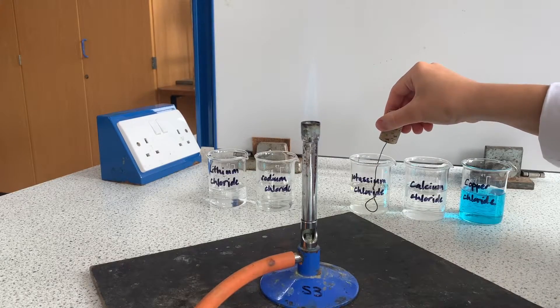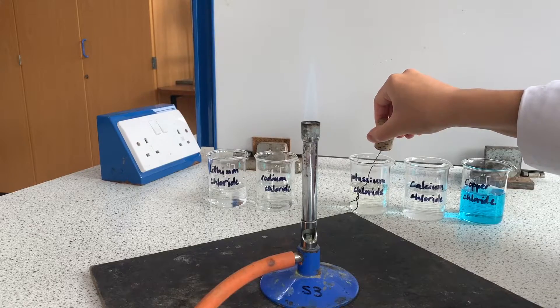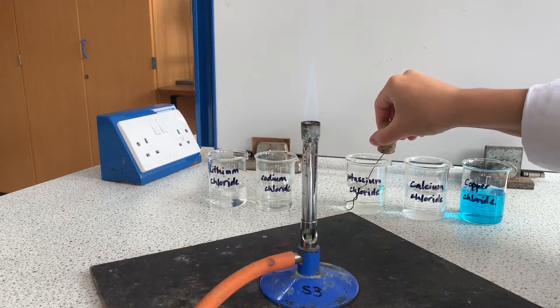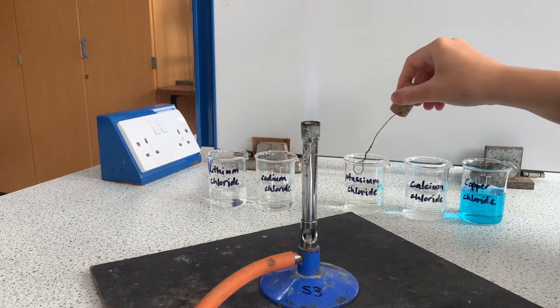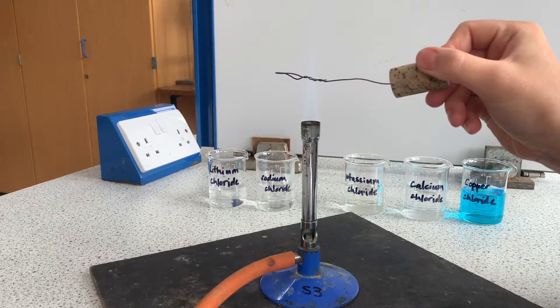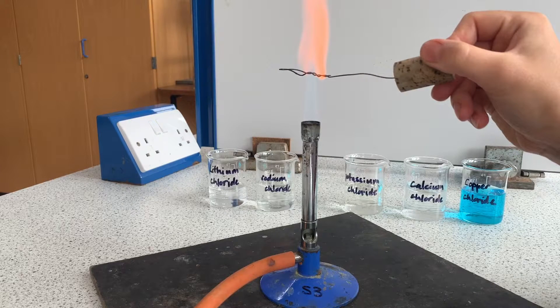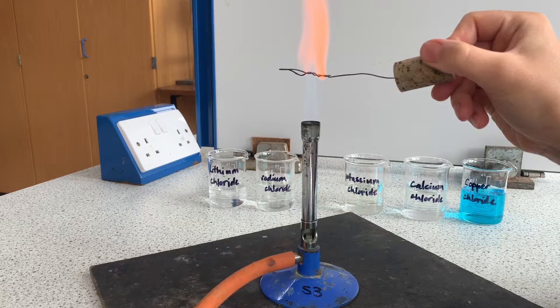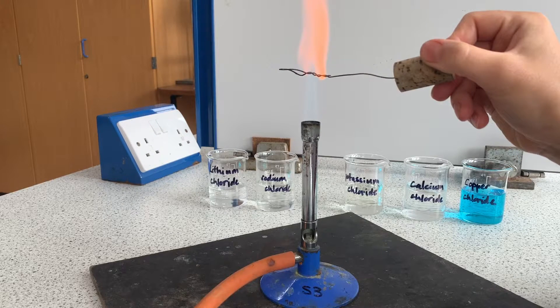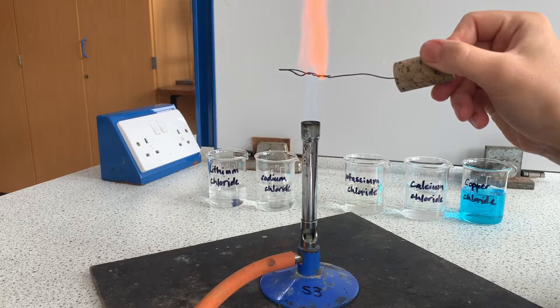Next I'm testing the potassium solution and this one's really hard to see. You'll see this flame is rather light looking and one half of it you can just about see a slight lilac color appearing.